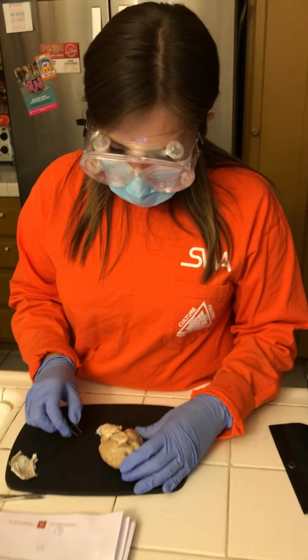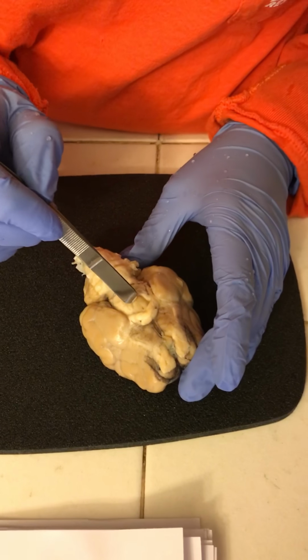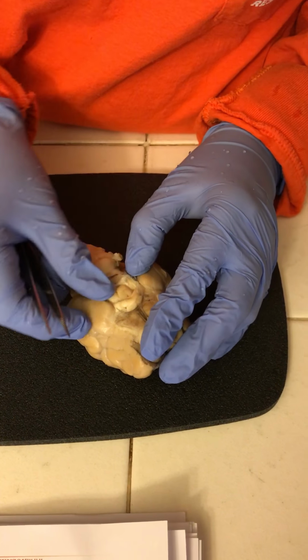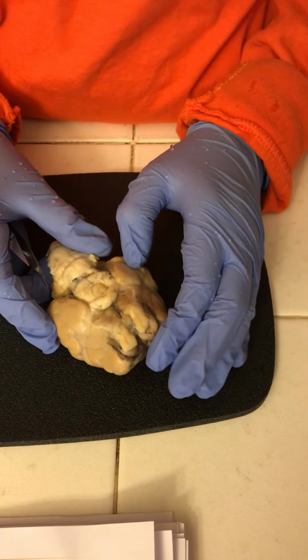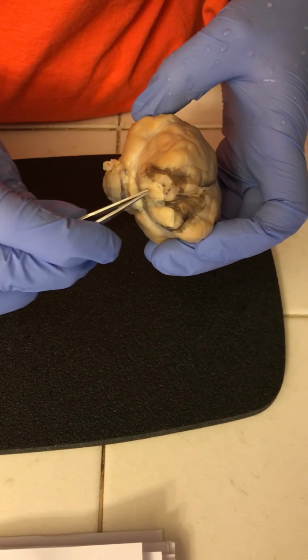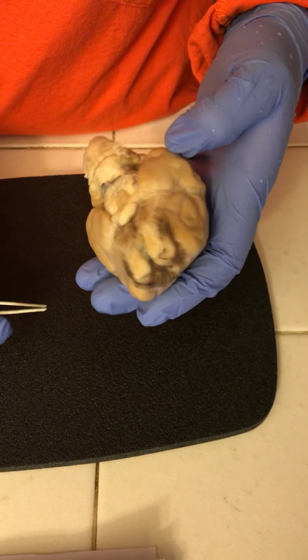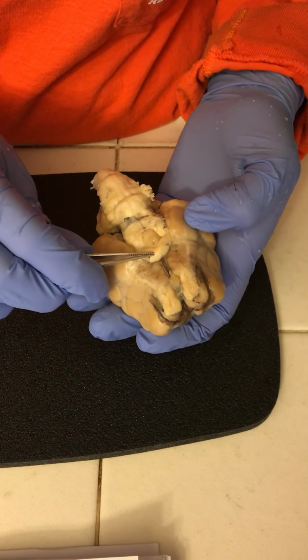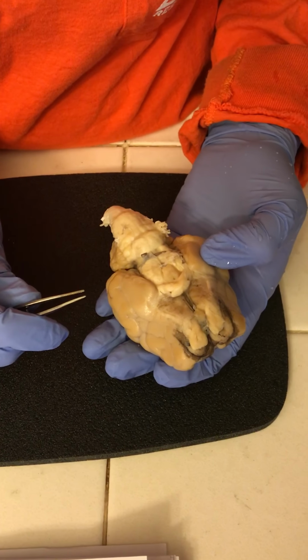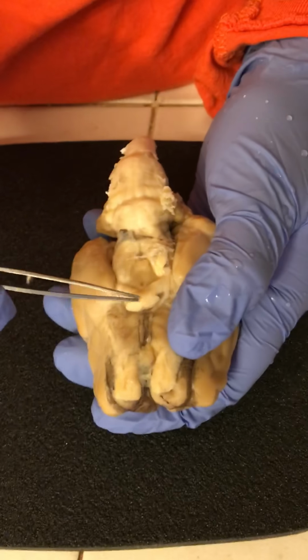Then we have the midbrain, which is basically the middle of the brain. So that would be more so like this part right here, the midbrain. Then we have the olfactory bulb. That's these two right here. So looking at the frontal, we have the olfactory bulb. The optic chiasma would be this part that I had mentioned earlier, which is now the correct one. And then we have the optic nerves, which we can see right about here.